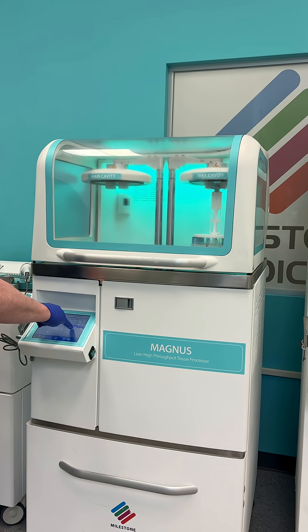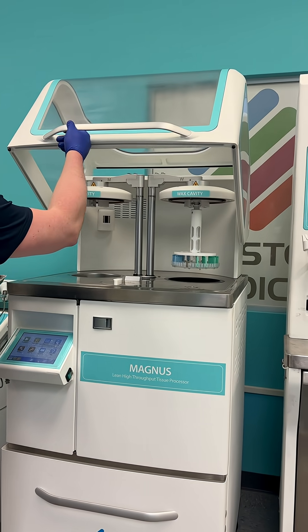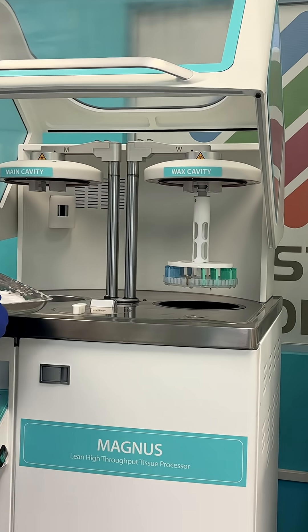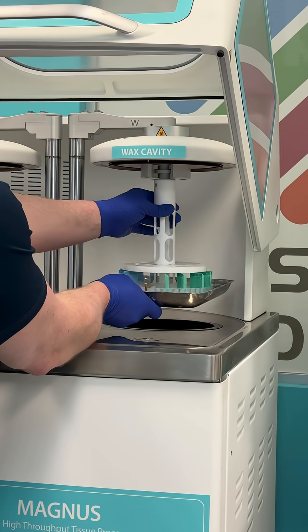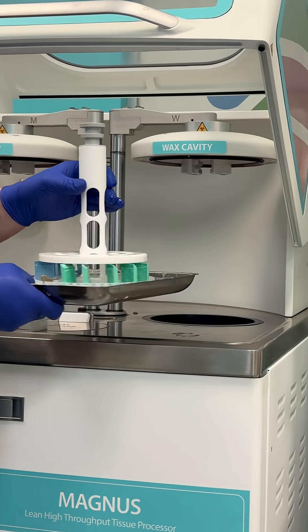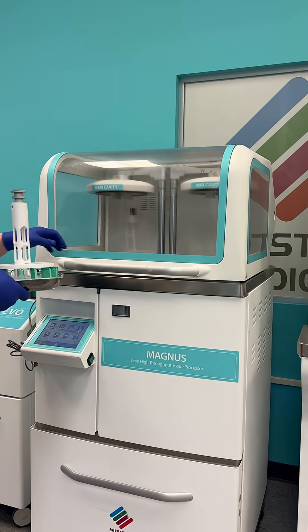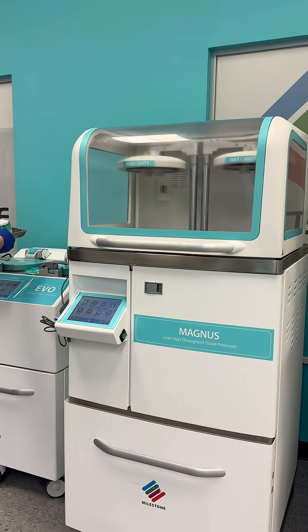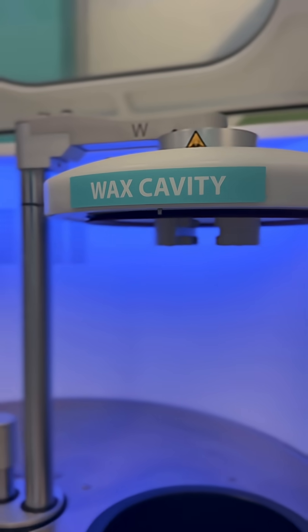Traditionally, clearing involves xylene, a hazardous chemical. But at Milestone Medical, all our processors are designed to be xylene-free, creating a safer, greener environment without compromising processing quality.